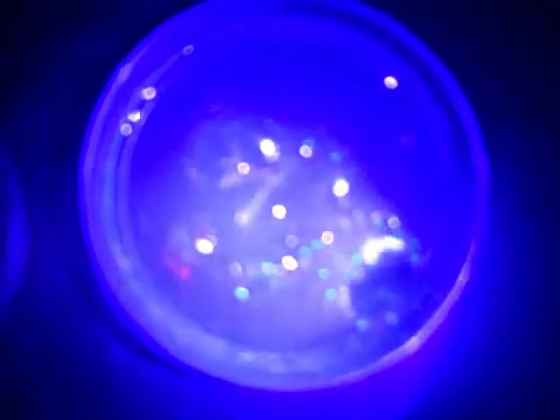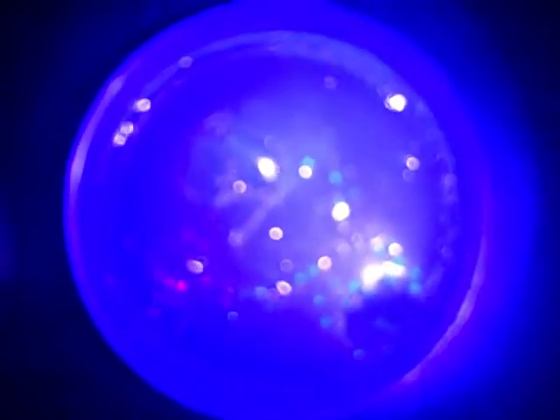Now when the lights go off and I hit them with UV radiation, the first plate, nothing significant happens. The second plate, nothing significant happens. But in that third plate, when I get in close here, you can see the fluorescing colonies of bacteria. They actually light up. And so that was kind of the point of the lab. We were successful. We introduced genes to our standard E. coli that make them produce a fluorescing protein within the bacteria.